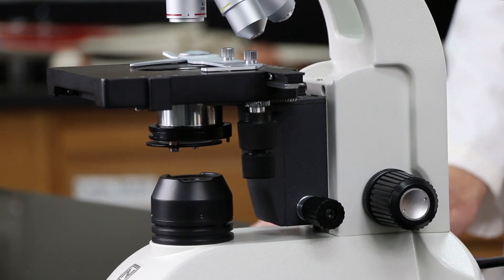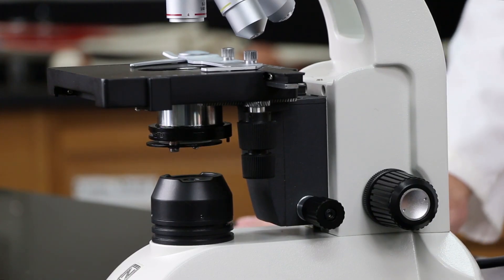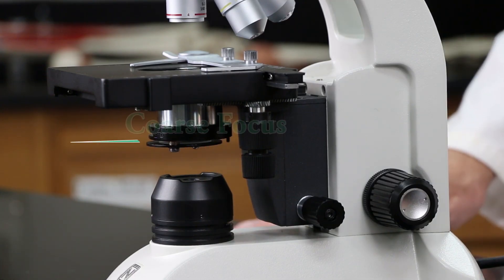These are parfocal microscopes. What that means is that when you first start out with putting the slide on the stage, that when you have it on scanning, use the coarse focus only.